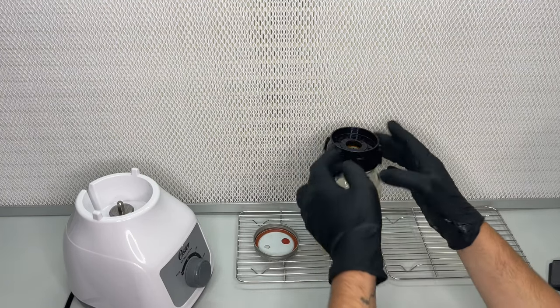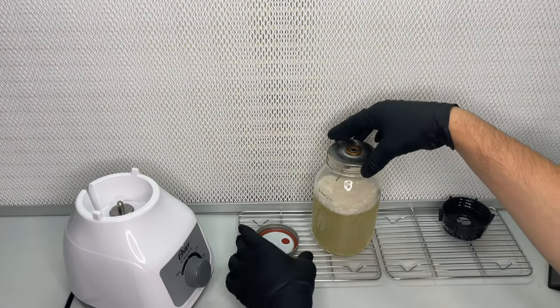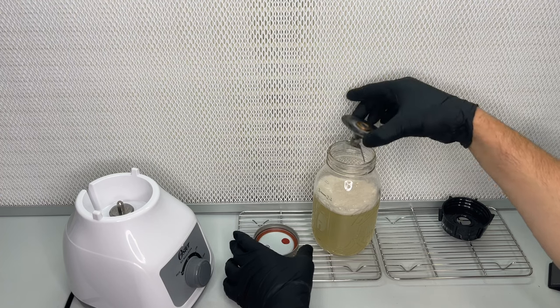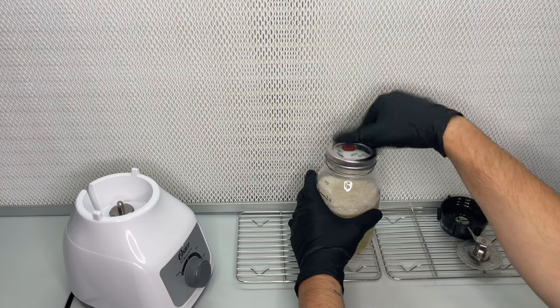This method could be very useful if you have thick mycelium that gets clogged in your syringe, or I've even heard of people using water and grain spawn and blending that and using that as a liquid inoculant.